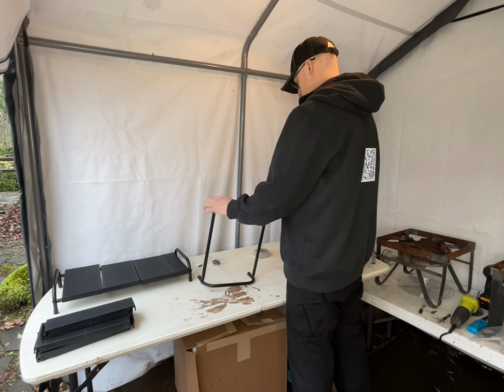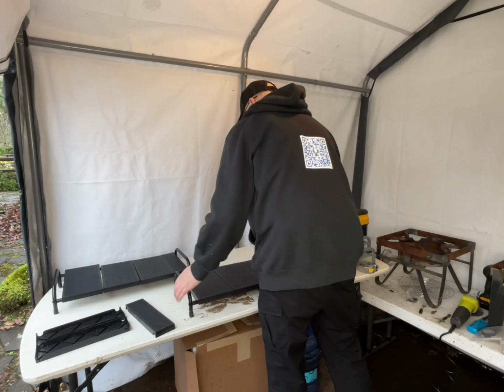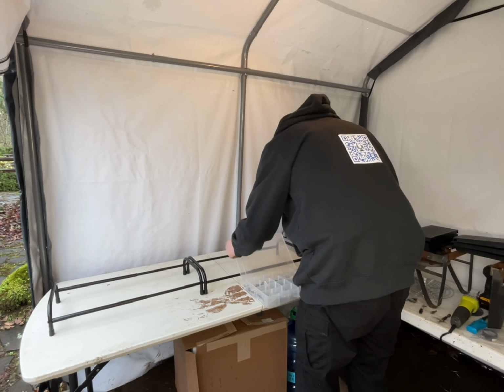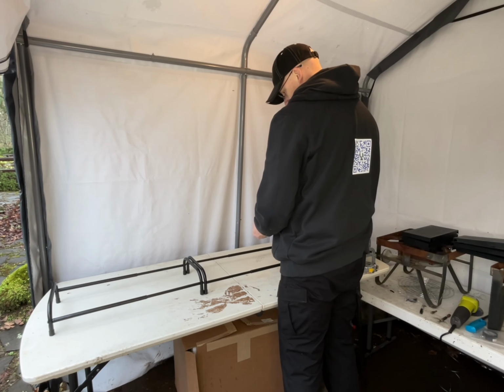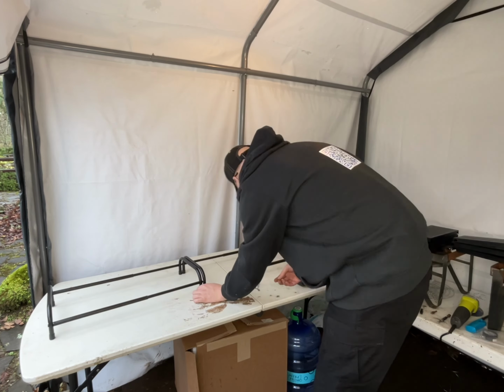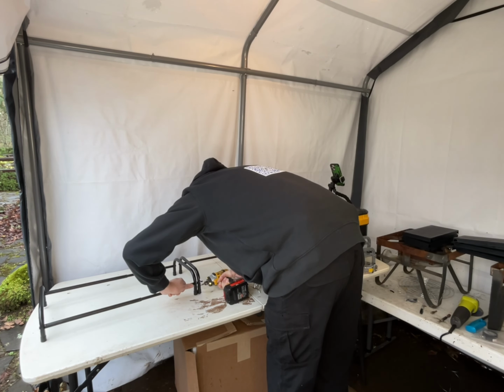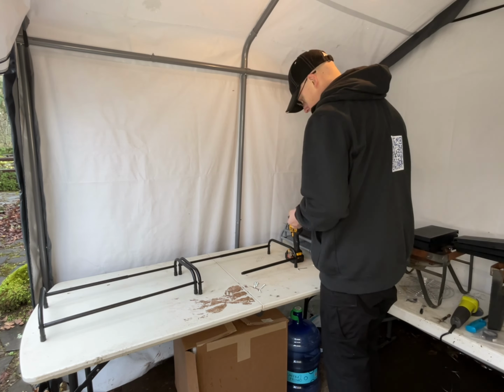So I'm going to build these two little sets, and I've measured them out to the width that I wanted. I put them all together, and then I'm going to line them up. I'm going to drill a hole through the tube steel that's holding it together on either side, the front and back. You'll see me here disconnecting the little rail to access it. I just use a drill bit to drill a hole, and then I use a metal screw, just one on each side, to hold it together. As long as you pick it up from the center, it won't ever present a problem. They're pretty lightweight, easy to move around.